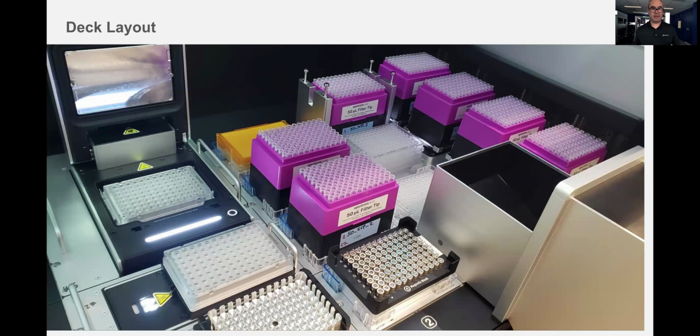So here is a picture of that previous setup, what it looks like in real life. The importance here is that you can see the topography of the deck, or the height of the different labwares. As I mentioned before, the different steps of the protocol have different pipetting requirements. Sometimes it's column pipetting, sometimes even single tip pipetting, which the 96 channel can do. Because of that, the 96 channel is a big block. It's not articulated, and all 96 channels go at once, so when it does a single column pickup, it will have an overhang into the adjacent positions.